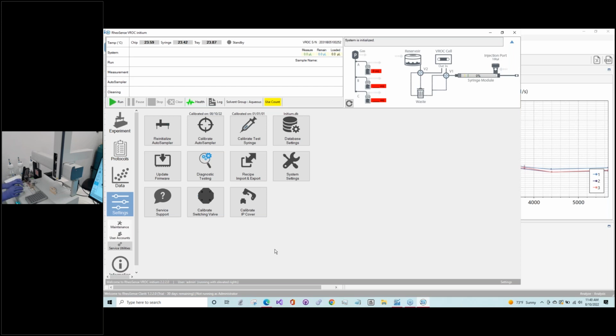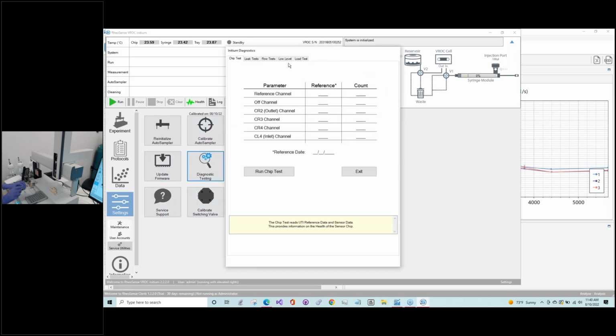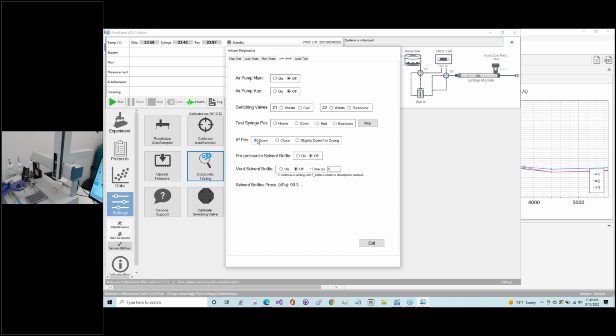And so in terms of connecting this, it's quite straightforward. You'd want to go back to that low-level tab to open up the injection port cover, and then use the tool that comes with your kit to remove the screw which holds the piston on the block here. And then there's another tool that is also included, because just like your chip, there's a fitting here on the tip of the connector for the test syringe that will connect into the switch valve.